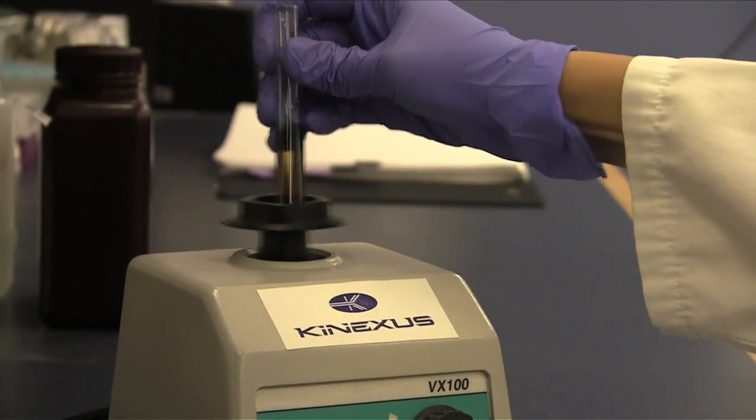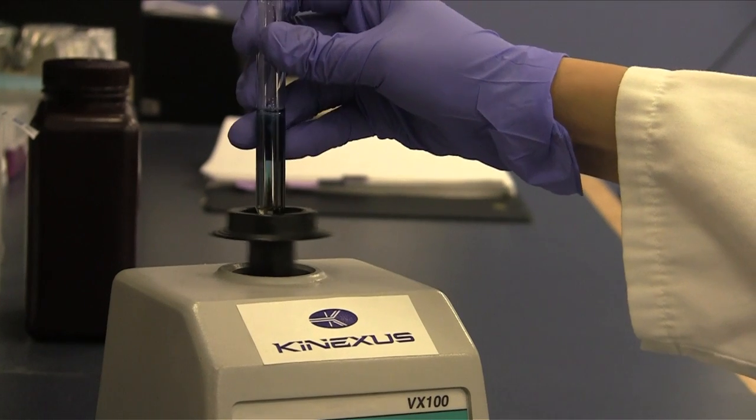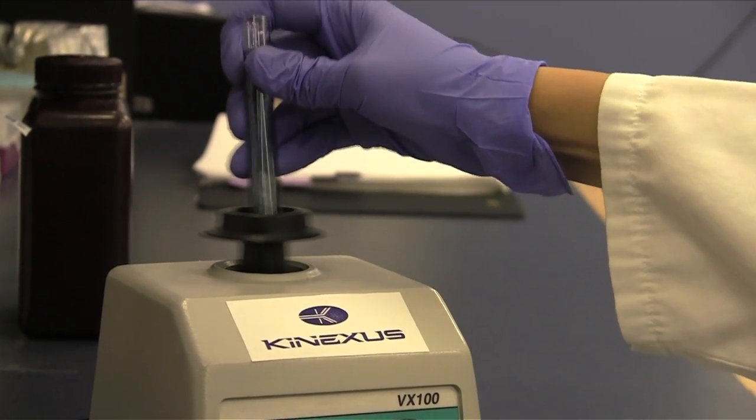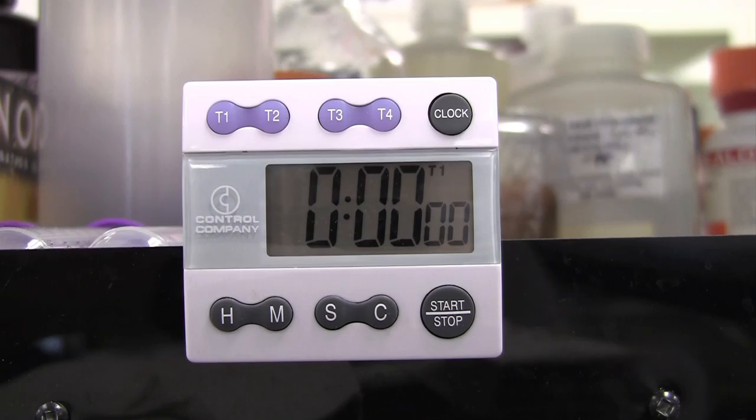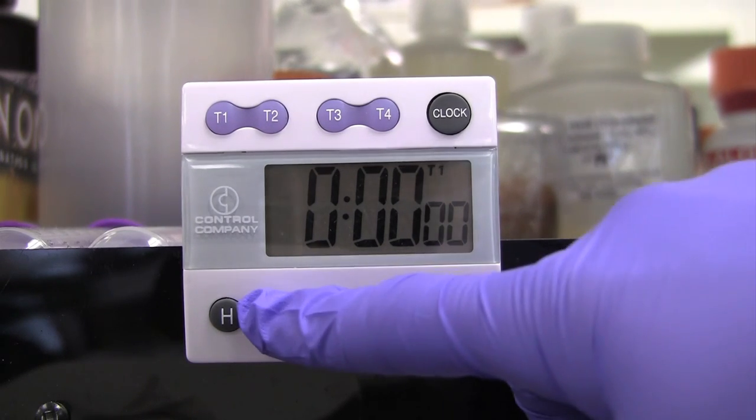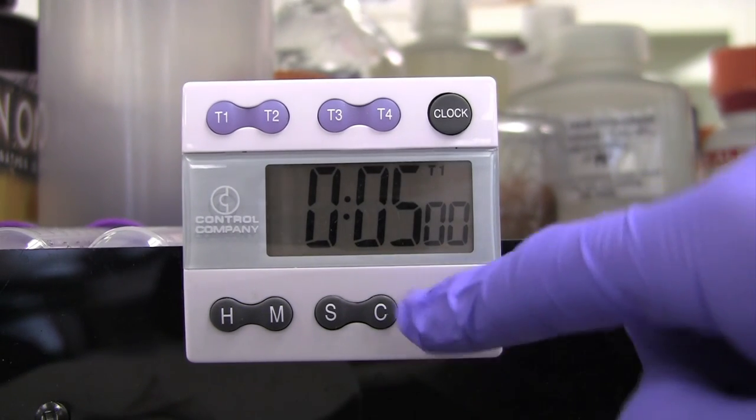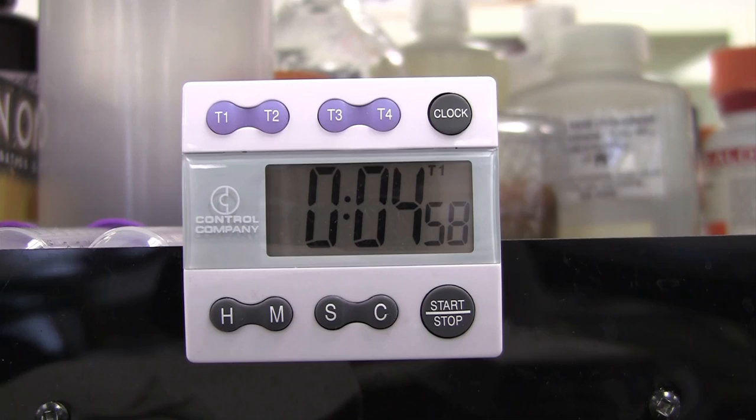Mix by vortexing for a few seconds. Allow the tubes to incubate for at least five minutes at room temperature. We recommend taking measurements of the protein concentrations within 30 minutes.